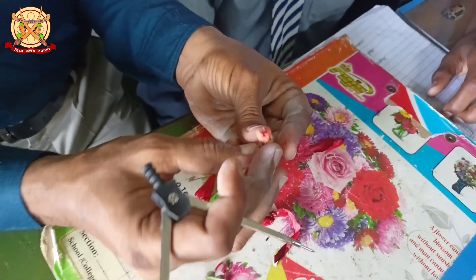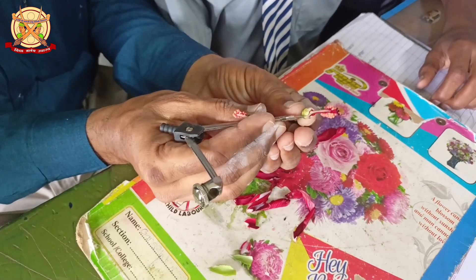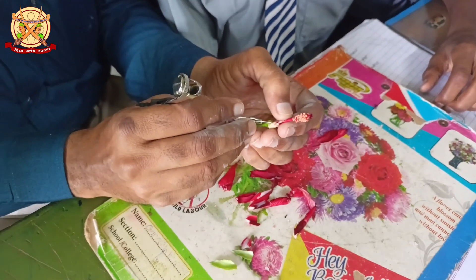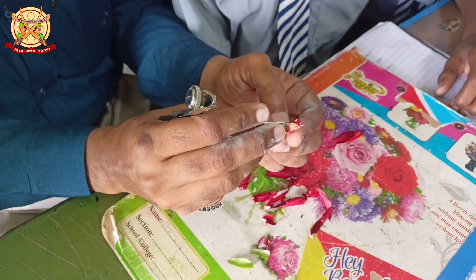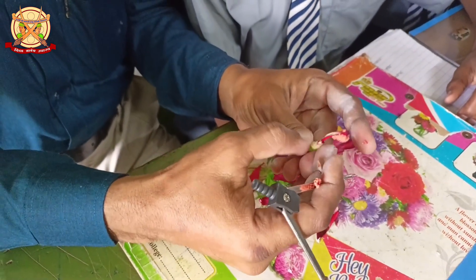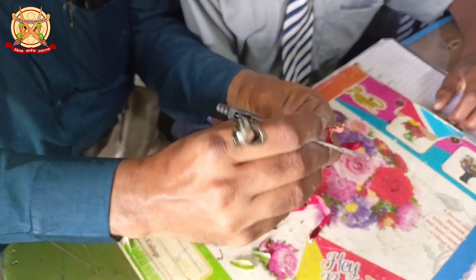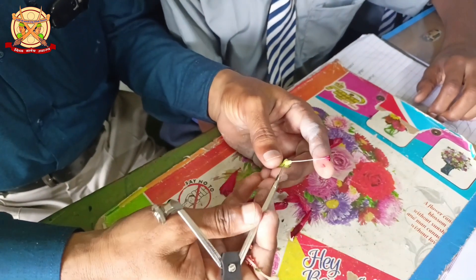Now slowly remove it. At the base, you will see a bulbous structure, and this is the ovary. Now we are removing the remaining staminal tube. When we remove the staminal tube totally, you will find a bulbous structure at the base, and this is now the whole carpel.